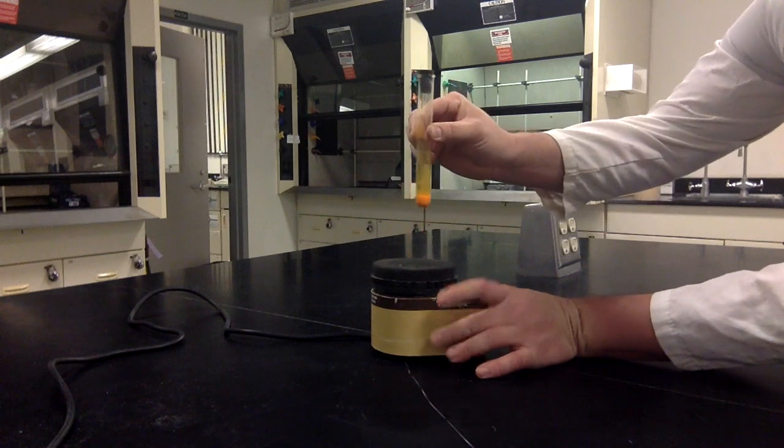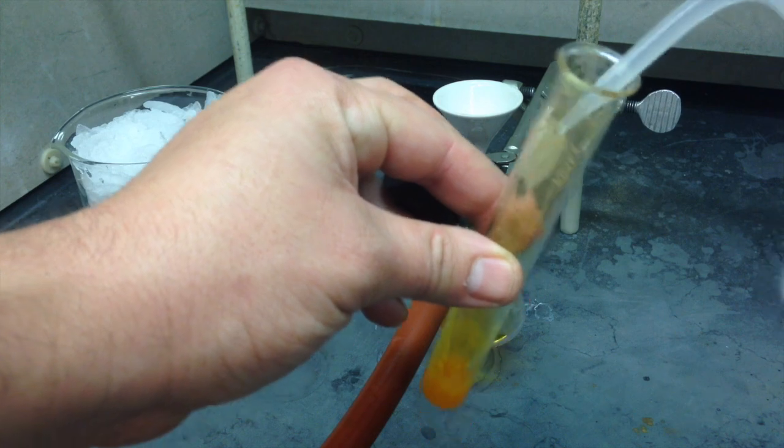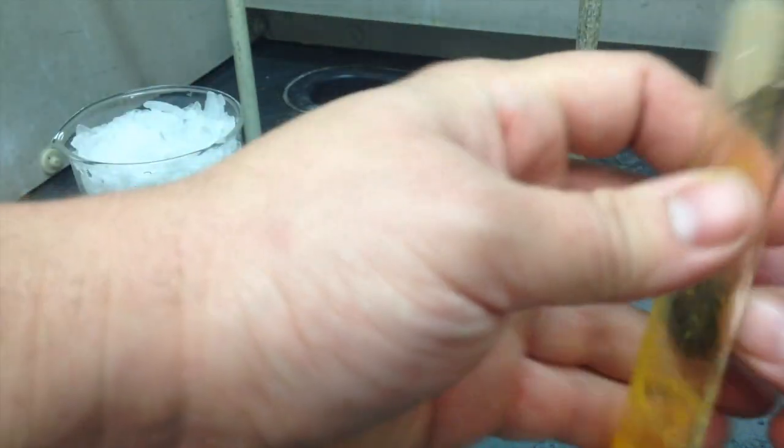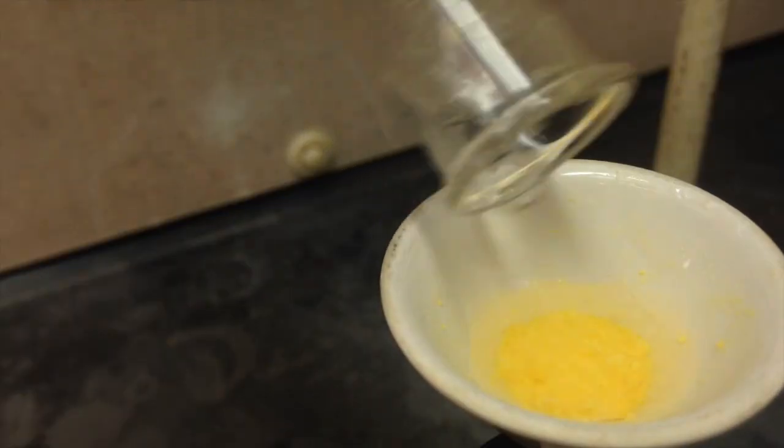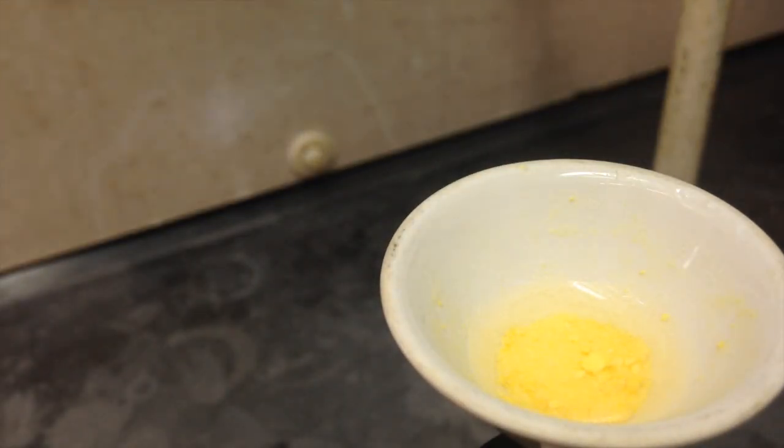Next step is to filter out your broken up crystal. In this shot, I already have my first filtration done. So I'm doing my second filtration with a little bit of extra water just to get what's left behind. When I dump it in, I dump it in all at once. These first set of crystals are kind of yellowy. That's because they have bromine on them. We need to recrystallize it to get it nice and pure.